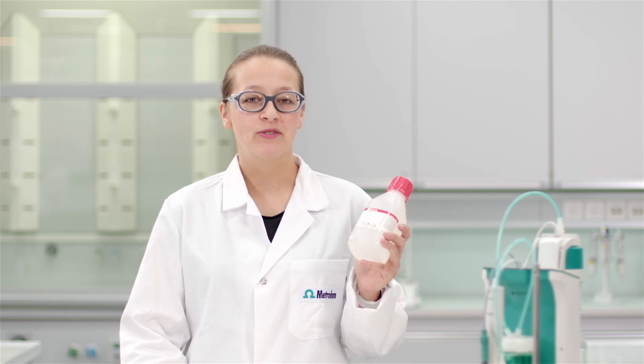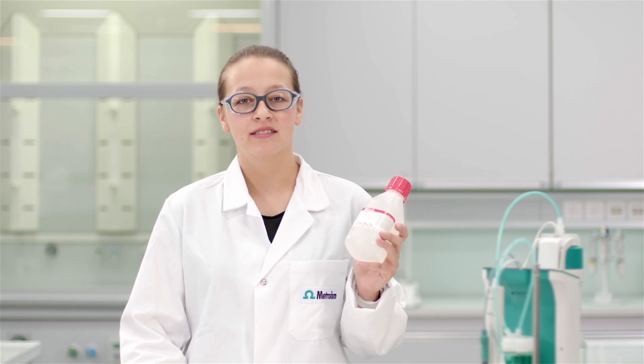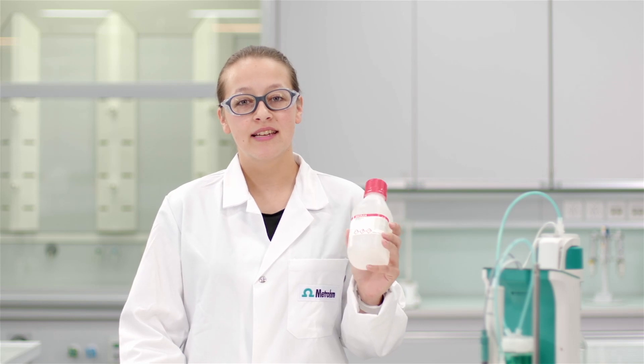For non-ionic surfactants, a calibration factor must be determined first by using the standard Tergitol 15-S9. This is necessary because non-ionic surfactants are non-uniform substances and their precipitation with the titrant sodium tetraphenyl borate is not strictly stoichiometric.